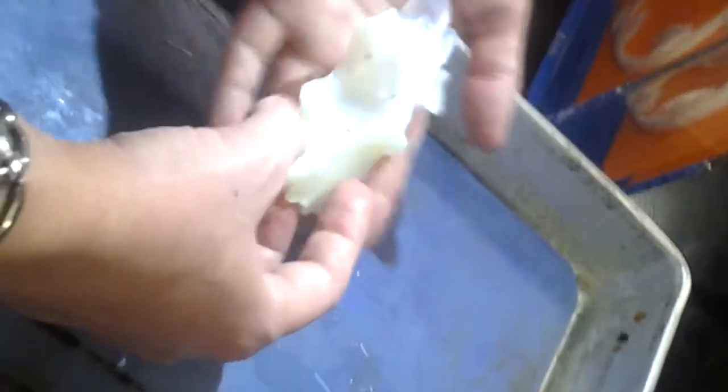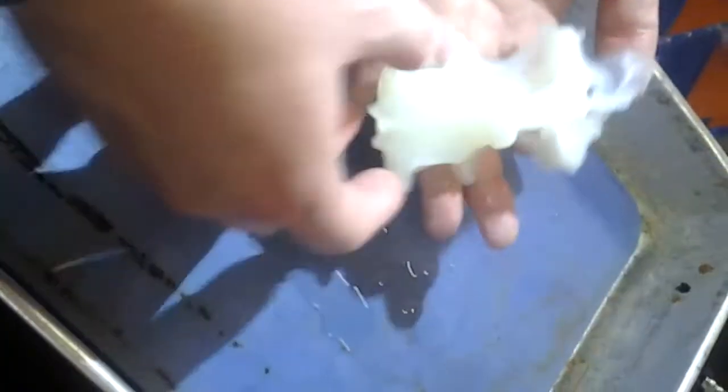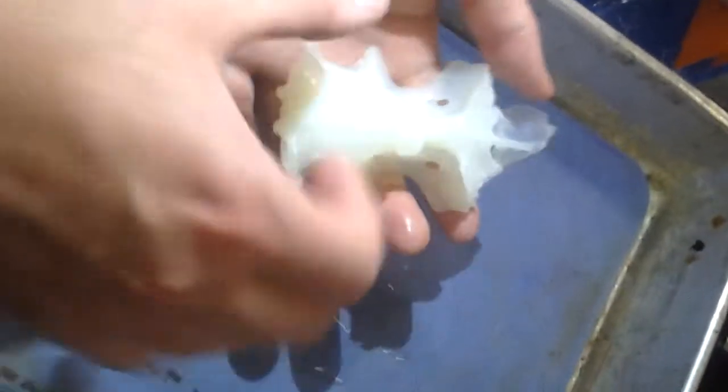Now, this is the ventral side now, right? Yeah, this is the ventral side. So let's see, what can we see here? Basitrabecular process. This is the internal carotid foramen. These are the basitrabecular processes here. Right, the jaw attaches here. The jaw attaches.